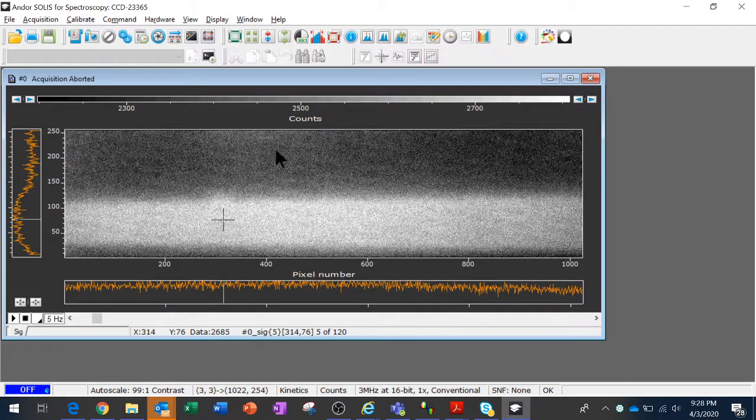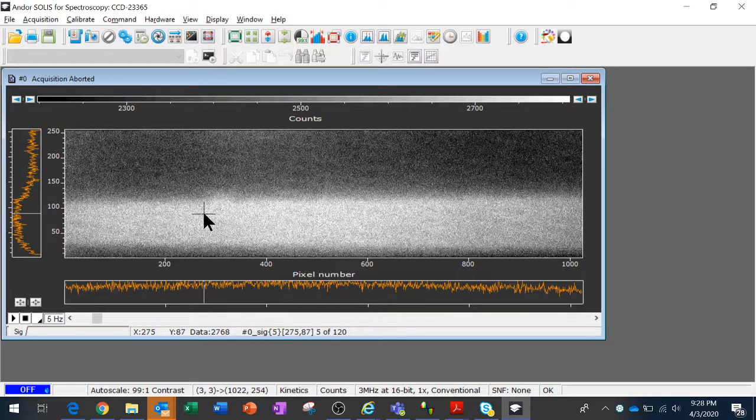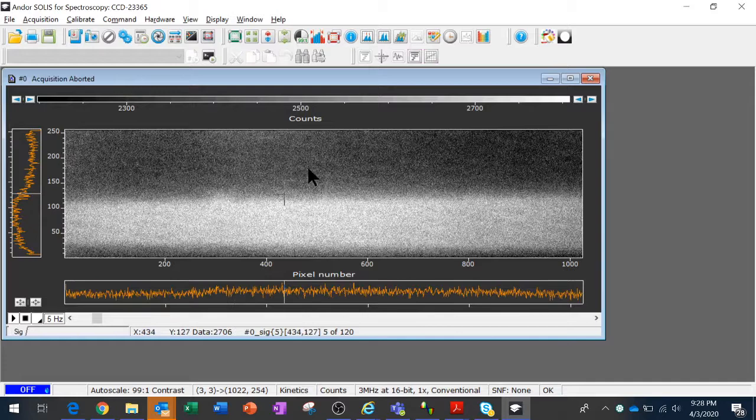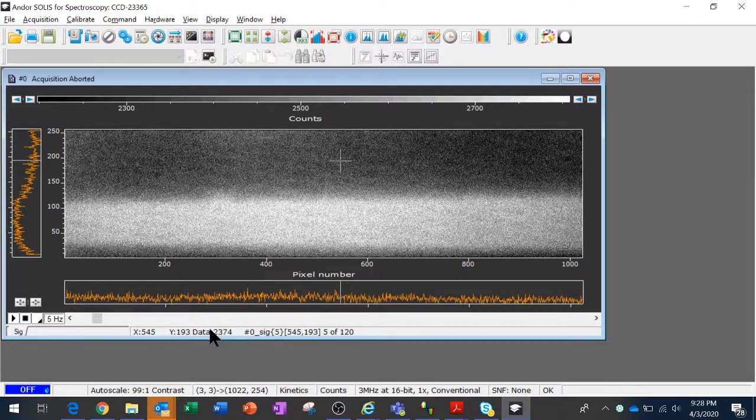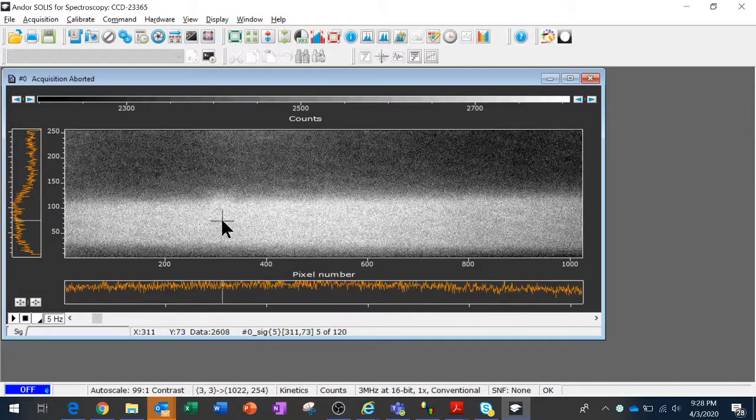So I've got my acquisition here that I just took, and I have counts in it, much more than I would expect, because right now I've got the front of the camera completely light tight. So the counts that I'm seeing here, you can see the data point that I'm looking at, a few thousand counts. It's not generated by light, which is what I'd normally like to do, but it's generated by heat instead. Whether you call this thermal current, thermal counts, or dark current, they are counts in the CCD that are not generated by light but by heat, and there's no way for the camera to determine whether that count came from light or heat.